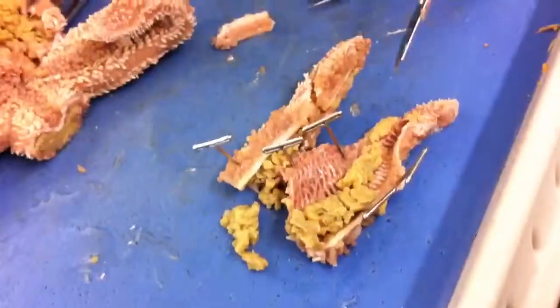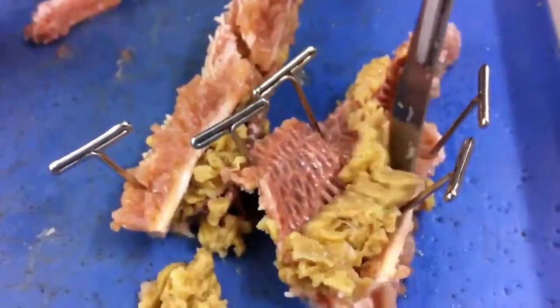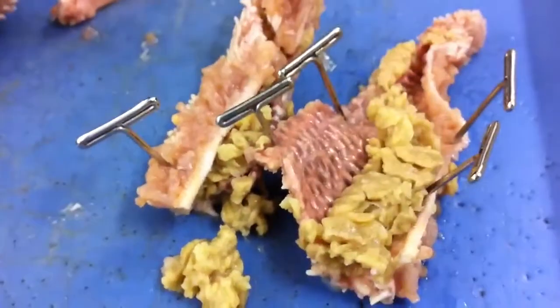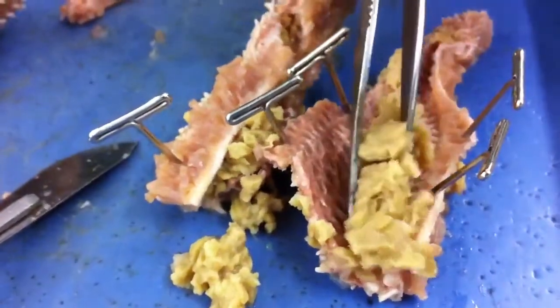What are we supposed to look for, just mess around and all that? I don't know. Alright, so this is a limb. I assume this is muscle right here — starfish muscle.